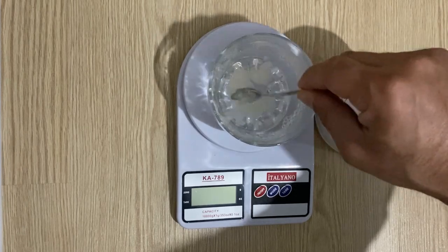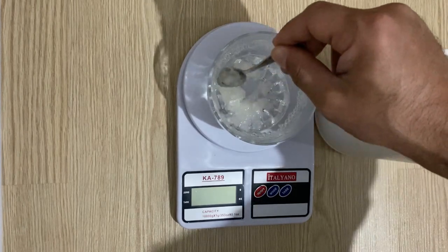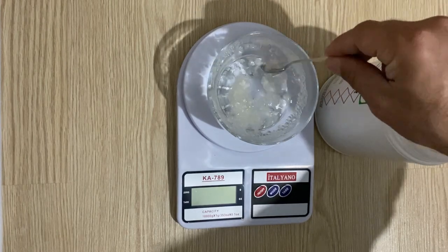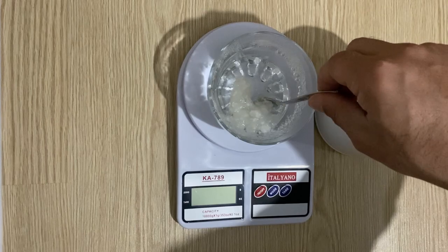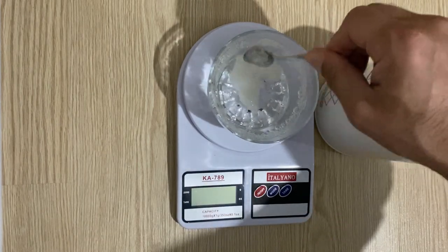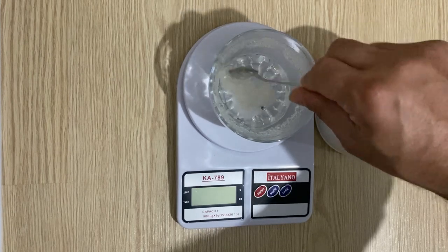You can use this binder for any application — for our supercapacitor, to make conductive paint, and also for example we can make slime with this binder and use it anywhere we want.